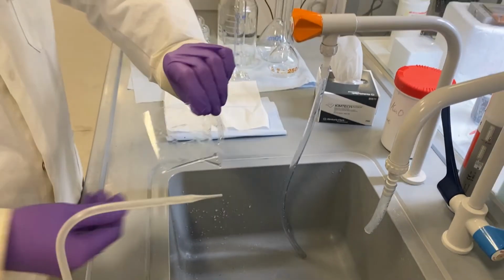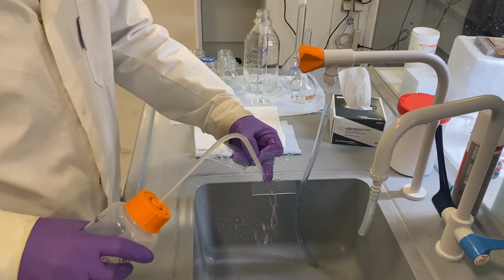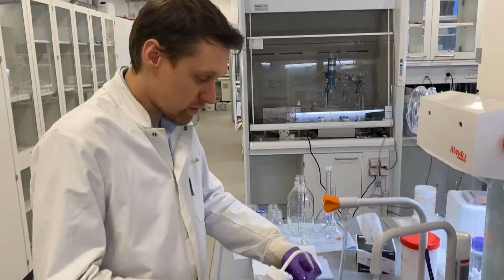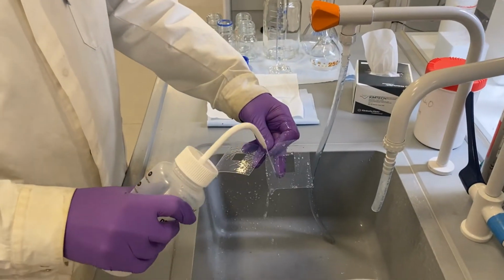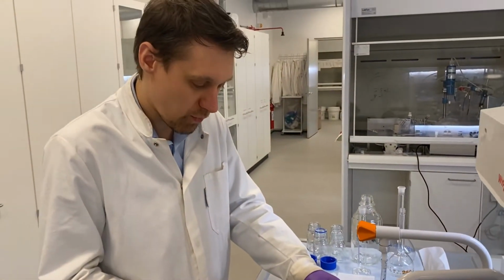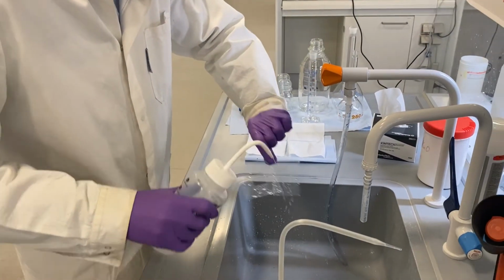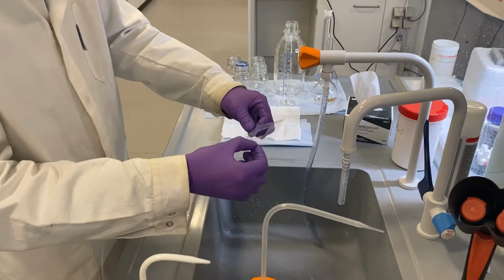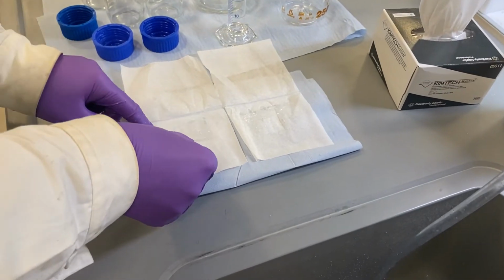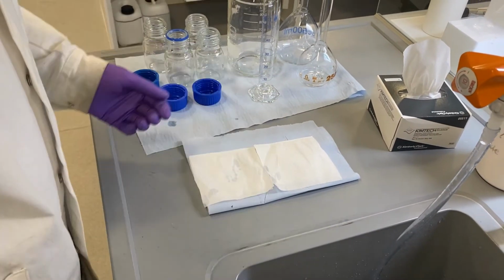So whenever we clean these, we start out by using ethanol. This will take off all of the dust and also any organics that should be left over on it. And then when we're done, we use water just to remove any residual ethanol that should be there, because even though it sounds a bit weird, the water is actually cleaner than the ethanol. When we're done with this, we put them here on some white tissues and let them dry, covered like this, ready for when we're going to need them.